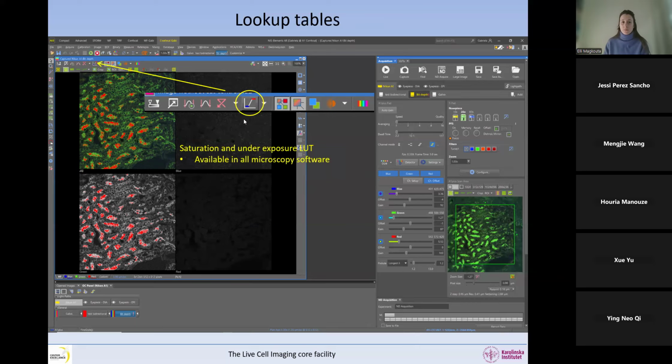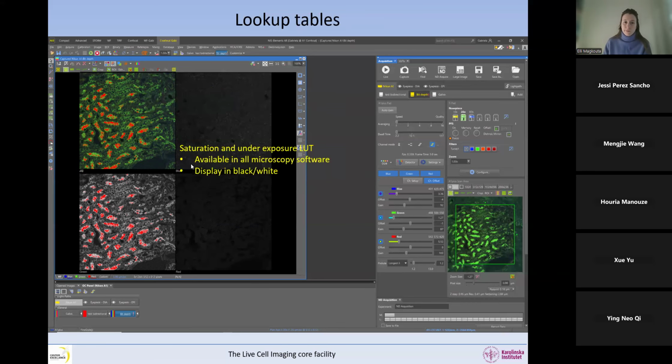So in a Nikon software, it looks like this, but in your software, I think you have already done this, telling me where that is in your software. How can you turn it on? And so the images are displayed in black and white with the saturated pixels in red. And what are the saturated pixels? Saturated pixels are the pixels that have the intensity of the max bit depth.